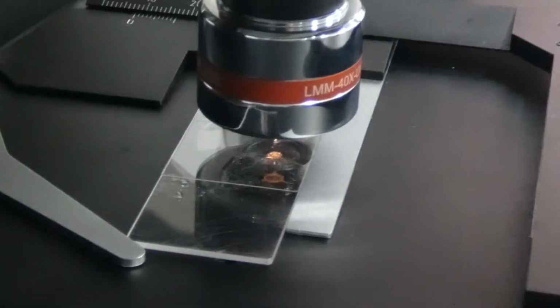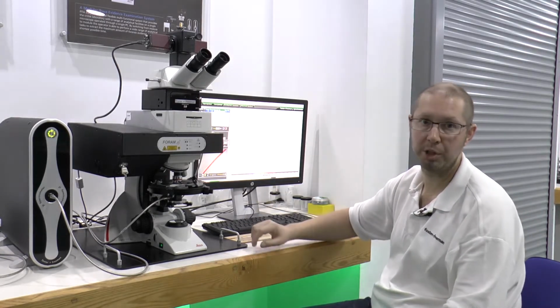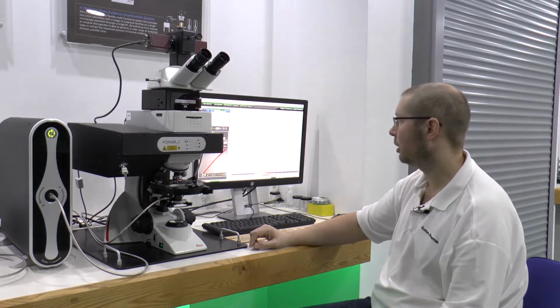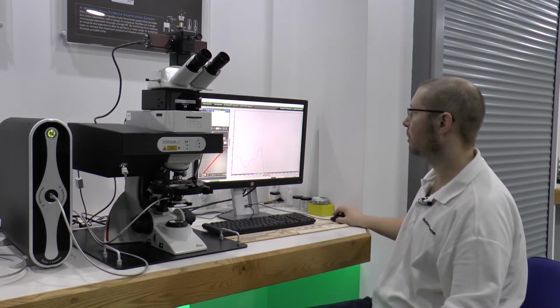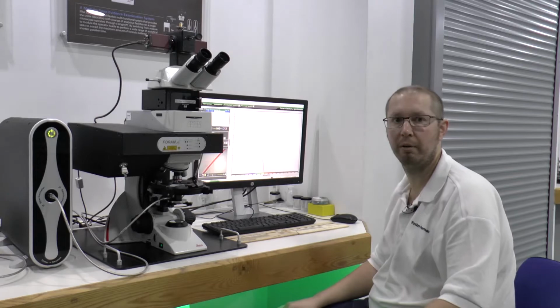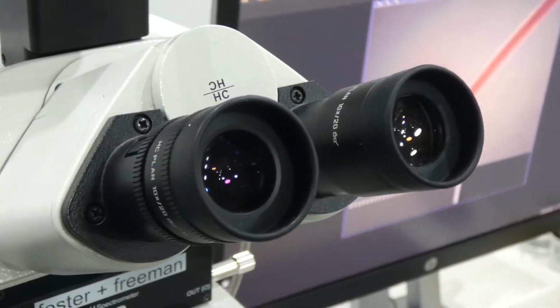The measuring aperture, depending on the objective that's used, for the UV system we use a 40 times reflective objective, and our sampling aperture is approximately 1.25 microns. So because of that, we're going to have to take a few repeat measurements of the sample just to sort of build up an idea of the range of variation that we're seeing across the group of fibres.